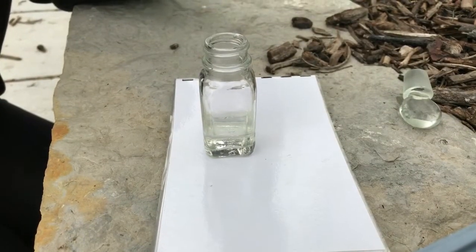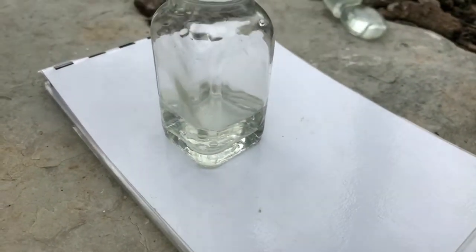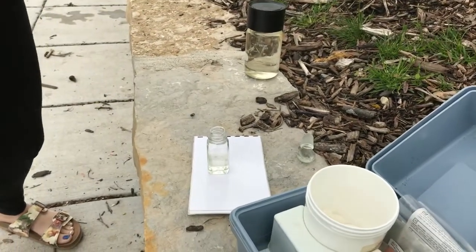Izzy has counted a total of ten drops for the color in the vial to match the white on the card beneath it. Therefore we will use the number ten to calculate the value on the chart of the gray book.